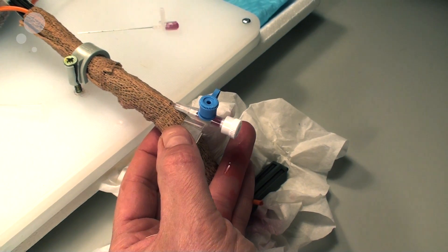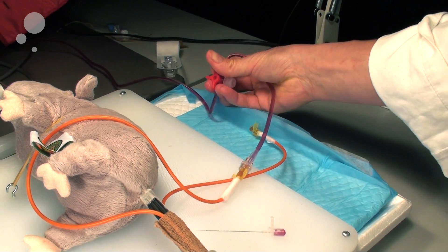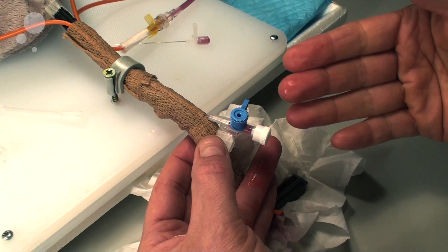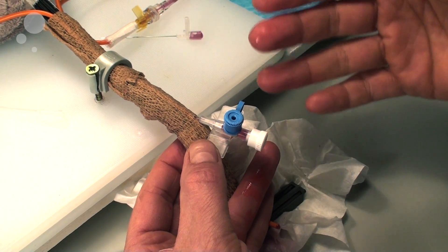When you have done that, you will cut off the blood supply on the stopper down here. Like this. And you will then be able to separate it. This is how you can train the procedure before actually working on the live animal.